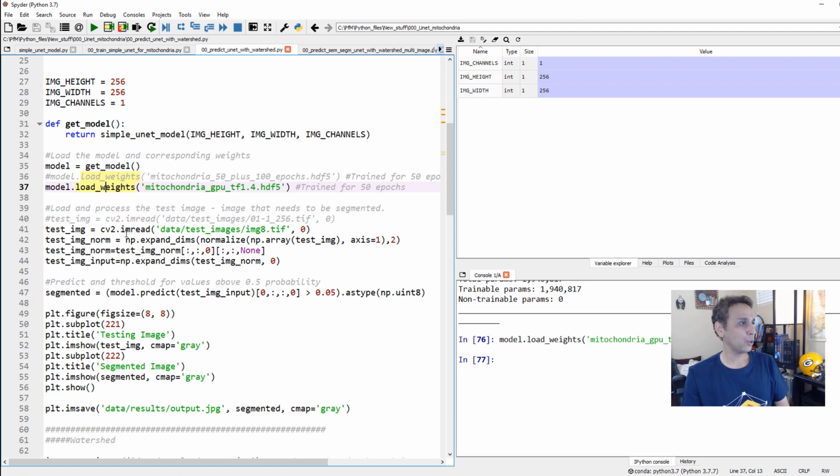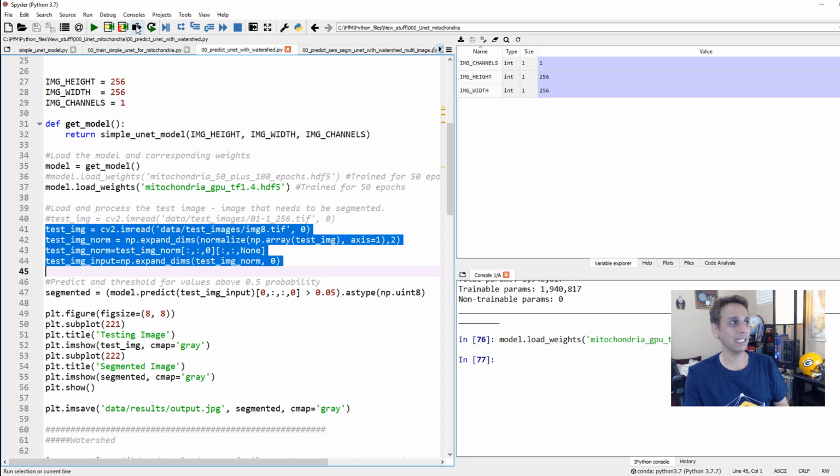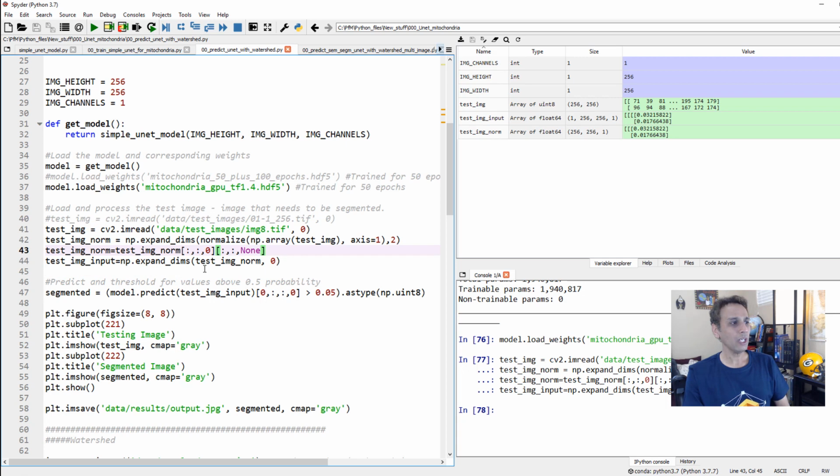Let's load one of the test images and pre-process it. How did we train our model? We expanded the dimensions and we normalized the pixel values, and this is the pre-processing that we did with our initial data. So I'm doing exactly the same thing. Now I'm ready to predict. How do you predict? Model.predict, right? That's exactly what we're doing here: model.predict on my test image input. My test image input has dimensions of 1 by 256 by 256 by 1, because I loaded only 1 image. If I loaded 10 images, that would be 10. Very simple stuff, but it's worth repeating.